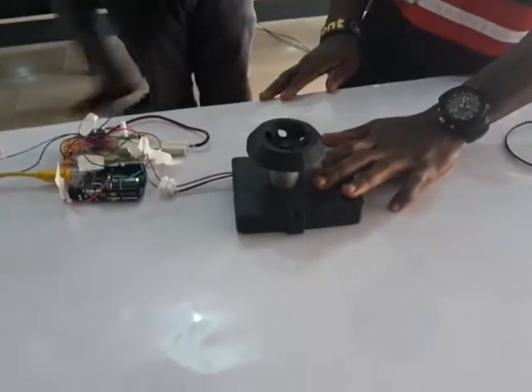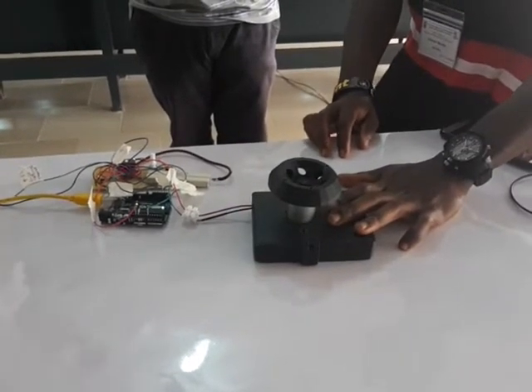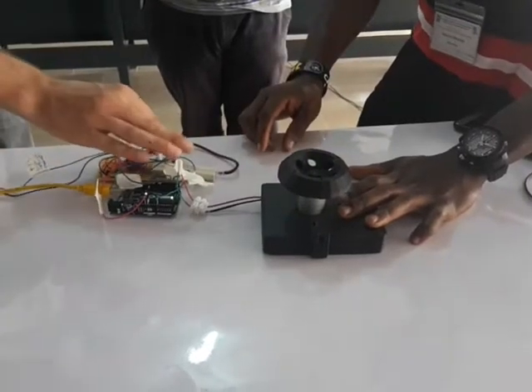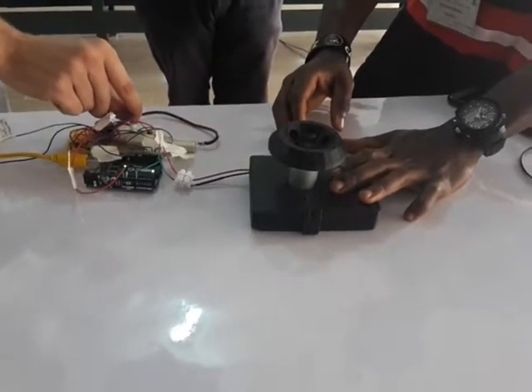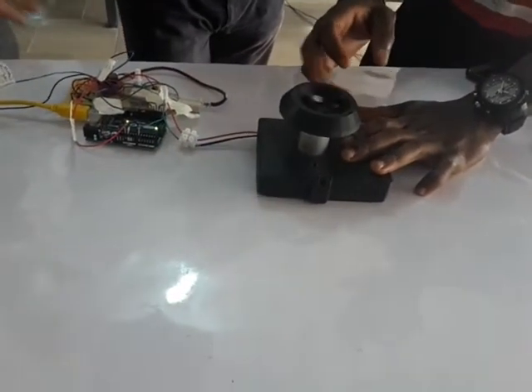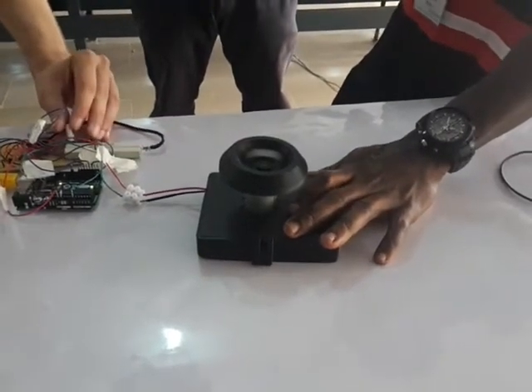Take 27. Shall we? Yes. No — wait, it did spin. Is it connected to all of the... alright. Centrifuge in Africa.